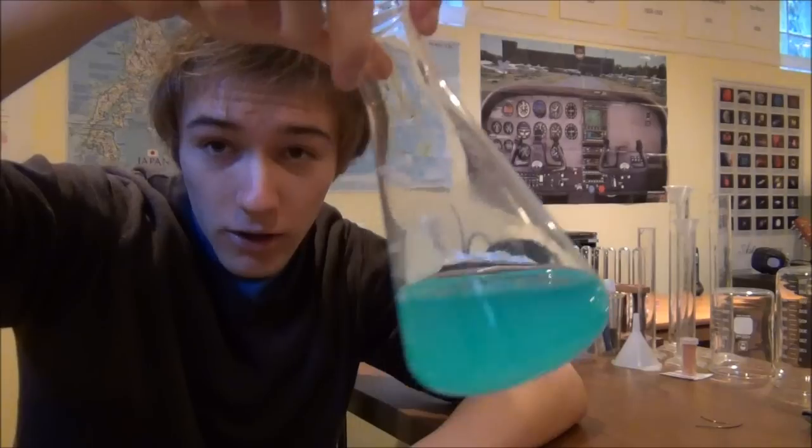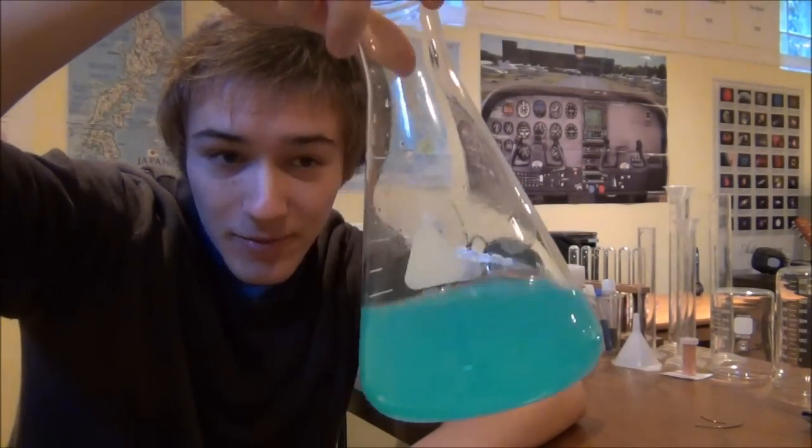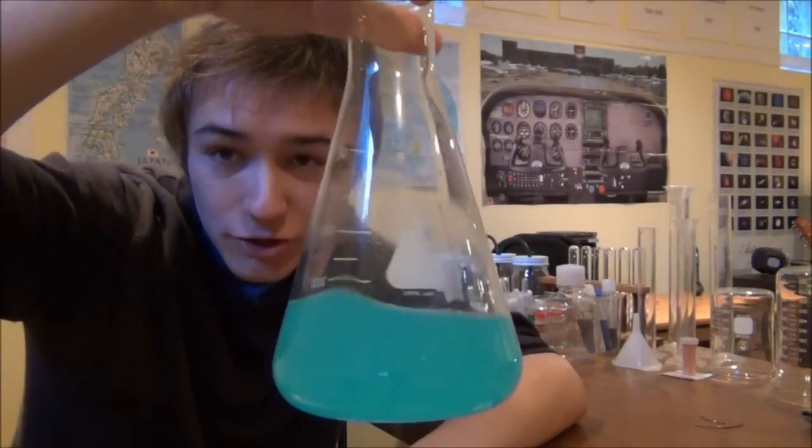Hi guys, so we're back in the meth lab again this week for some simple demonstrations of redox or oxidation reduction reactions. We're going to be doing those with one of my favorite chemicals which is copper sulfate or cupric sulfate, and the thing I love about it is this bluish green color.